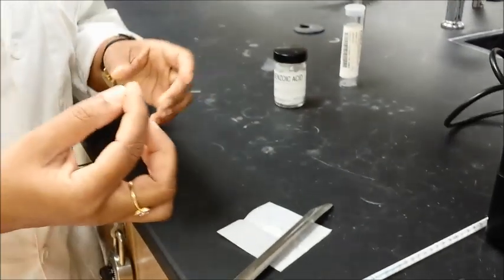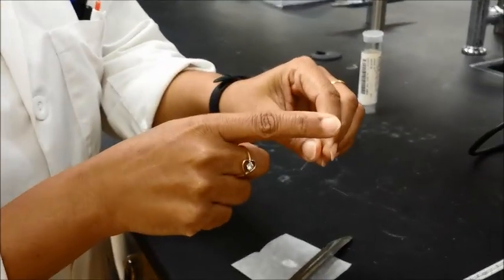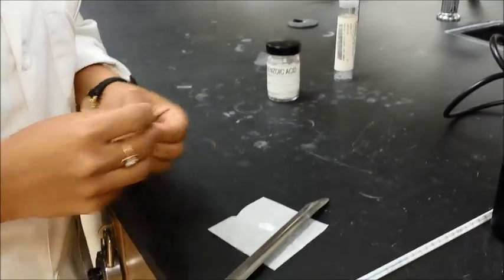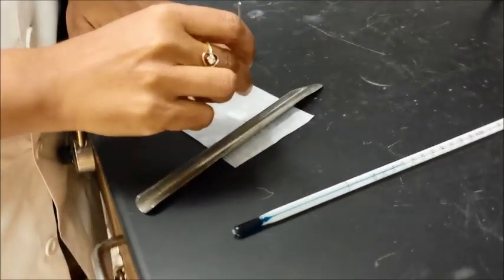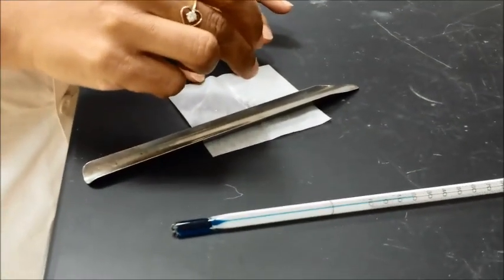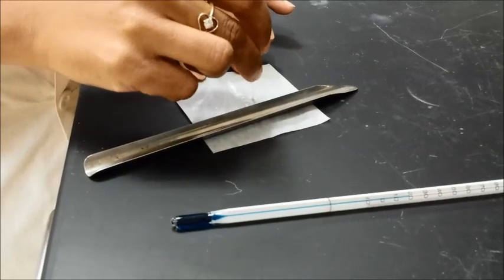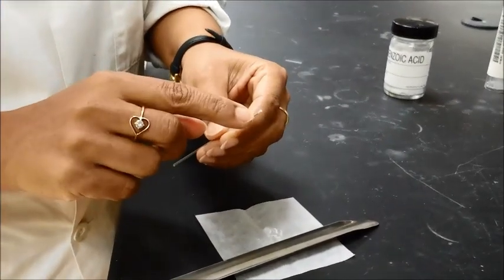Then you will get your melting point capillary and again take the open ended side, and then stand it upside down, open ended down, and try to get a little bit of sample in there. And you can see the sample that's on the end here now.